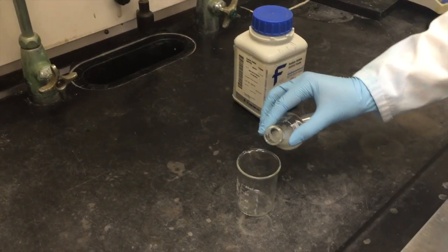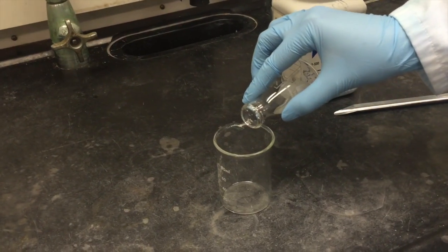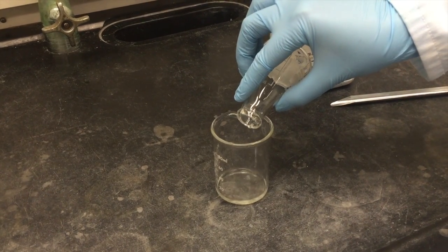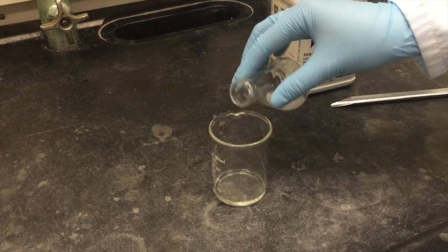To remove the organic solvent from the sodium sulfate, decant by gradually pouring the organic solvent from the flask to another flask or beaker while leaving the sodium sulfate behind.